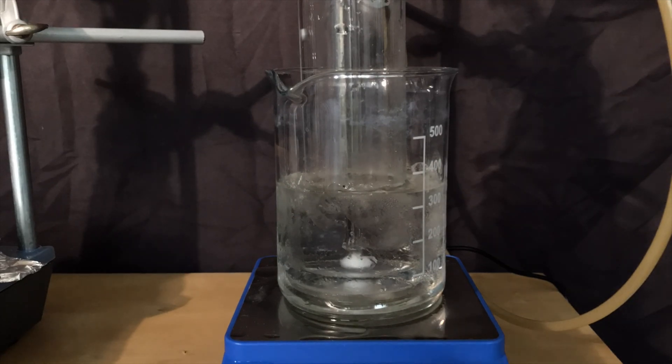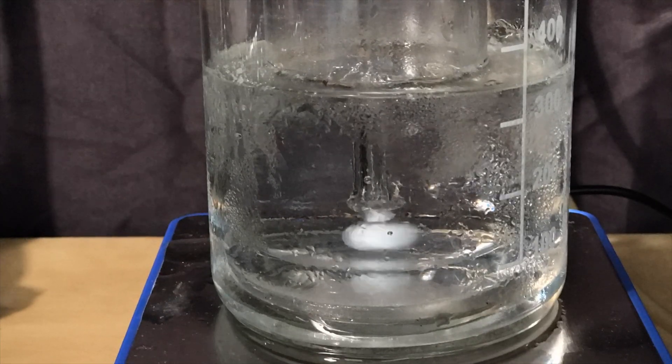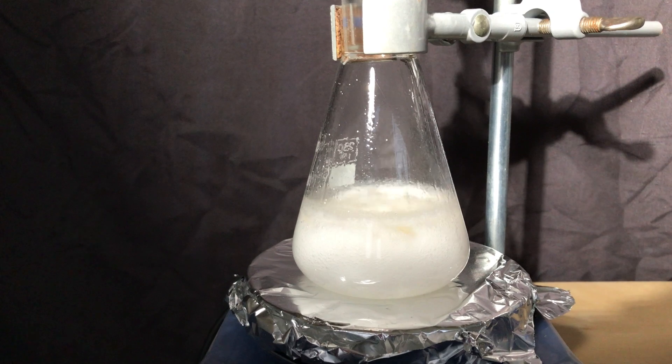The moment it looked like no more bubbles came over, the entire apparatus was probably already filled with dimethylamine. It doesn't look like any product is coming over, but don't be deceived by it. This is dimethylamine. It dissolves. It's highly soluble in water and therefore the bubbles won't even rise to the top.